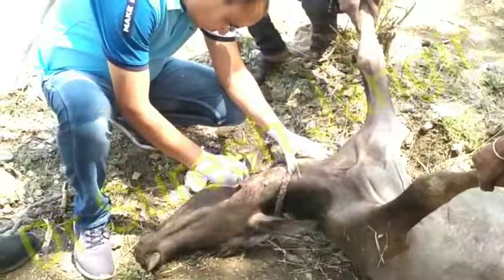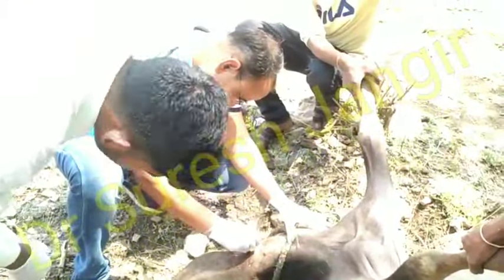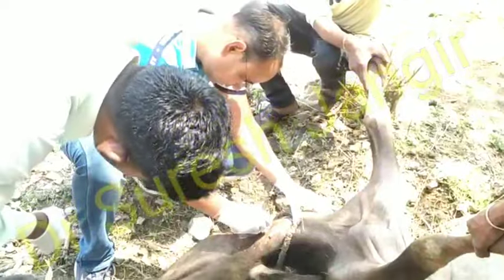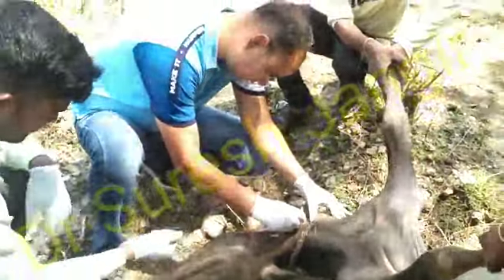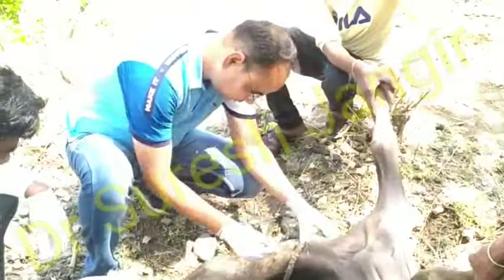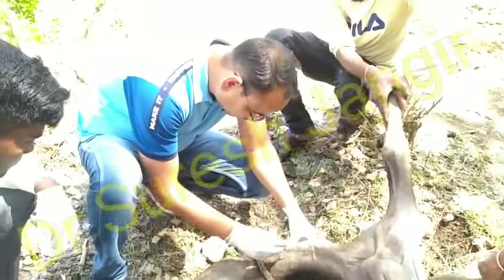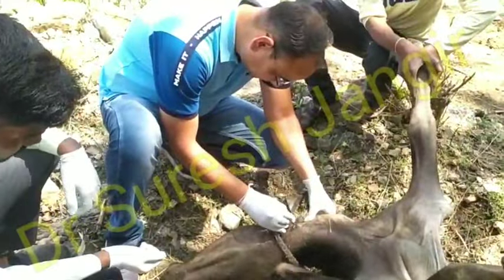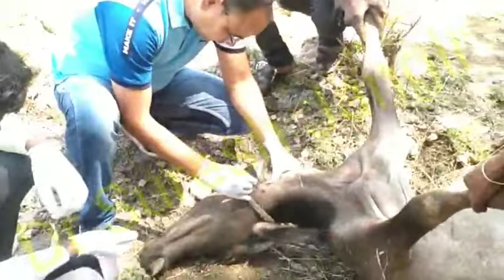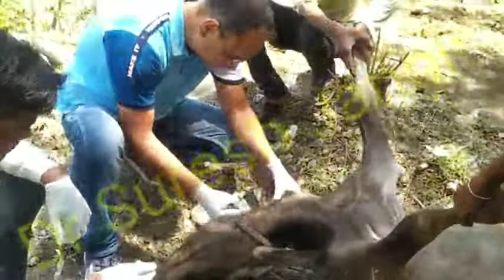According to the animal owner, this buffalo is suspected to have died due to an attack by a wild animal. In this case, we required a written request from the related departments. After the written request, we are here for the necropsy or post-mortem examination of this buffalo.